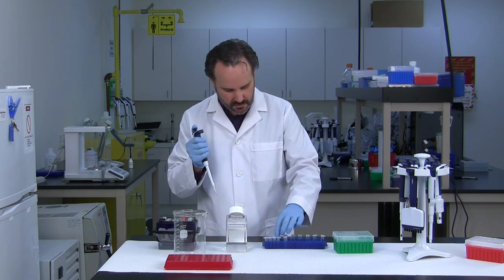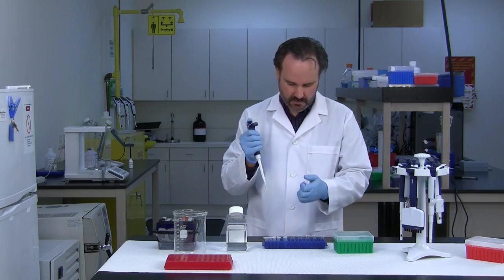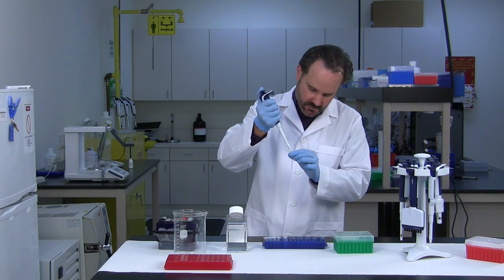You can improve your pipetting accuracy by up to 1% with good dispensing technique.